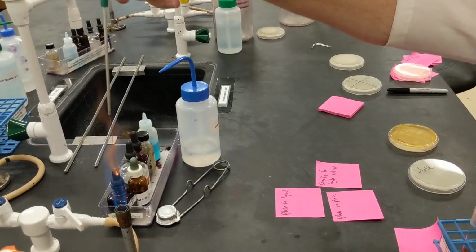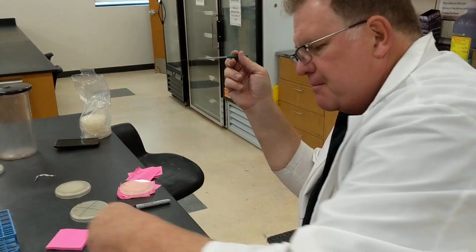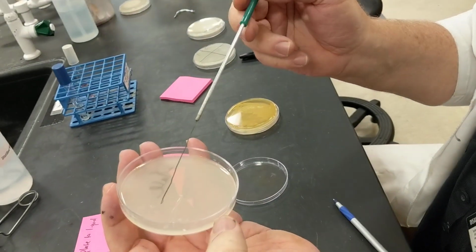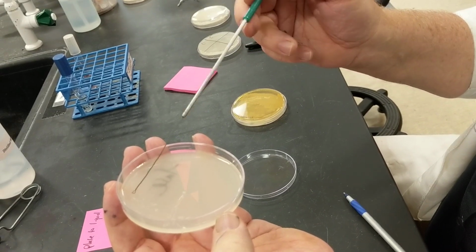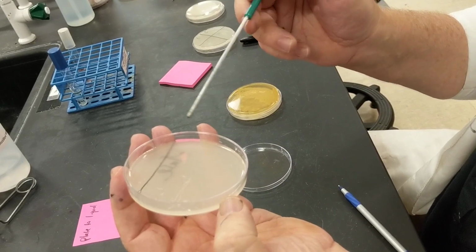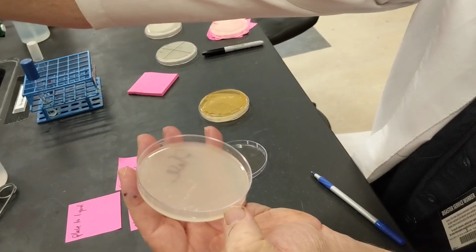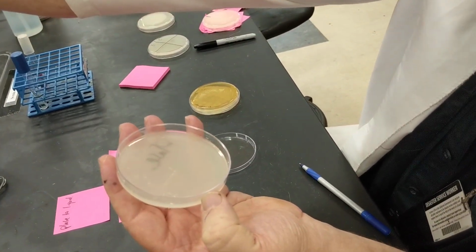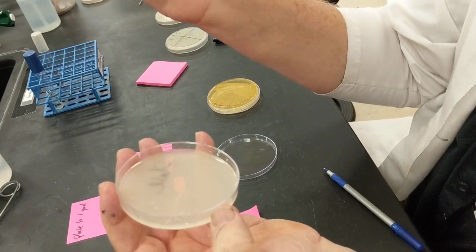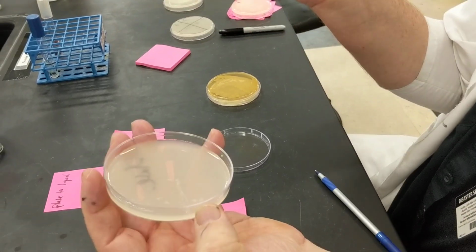So I'm going to flame my loop and get the bacteria off of there. And so let's just say on that line, I put 100 bacteria on that line. And what I'm going to do now is take that bacteria and spread it out over half of the plate. And so it's like I'm coloring the plate, all right? And so now that bacteria, all 100 of them, instead of being just in that one spot, are now all over that large area. They're in 1/10 of the area. And so instead of having 100 bacteria per unit, it's now 10 bacteria per unit if it's on 10 times the plate.